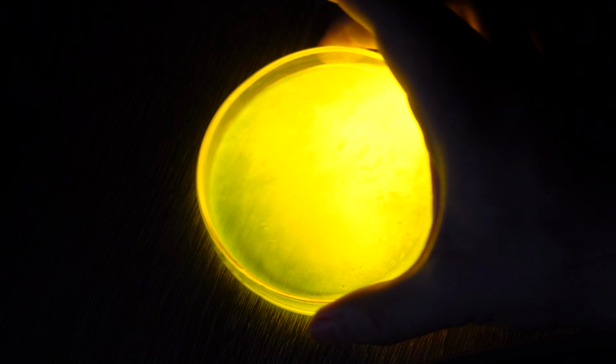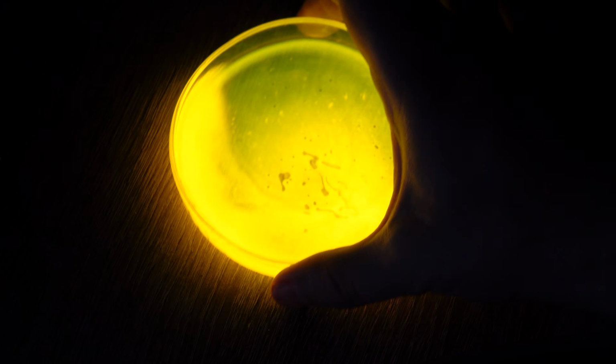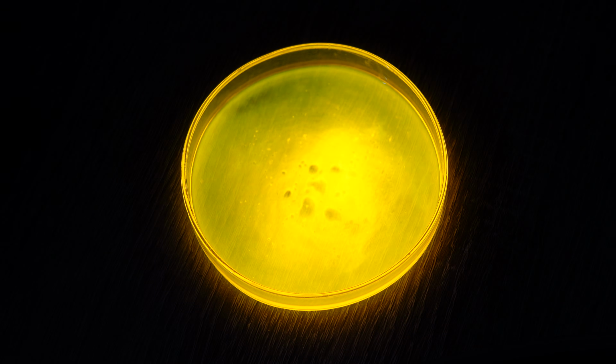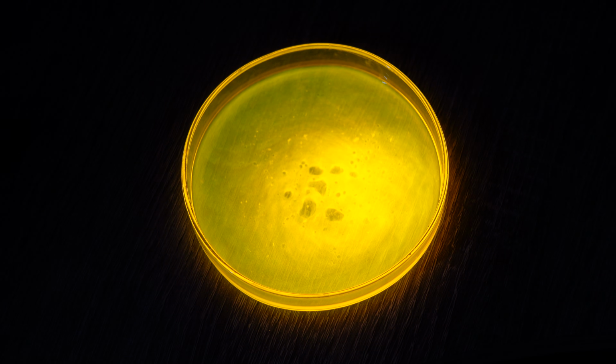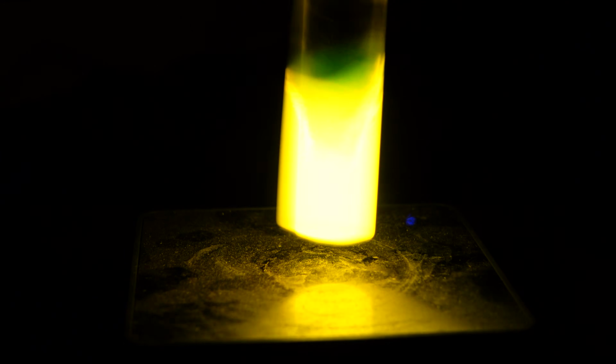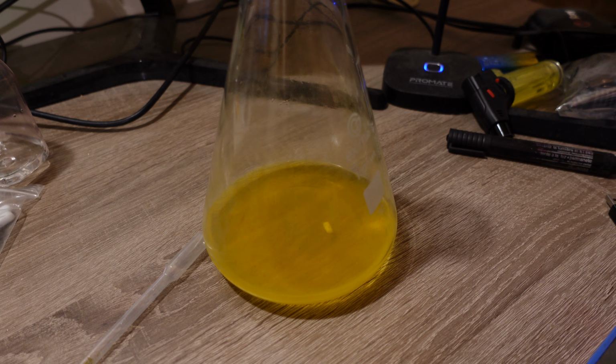I want to remind you that for all the reactions in this video, I used about 100 milligrams of dinitrophenyl oxalate, so 1 gram will be enough for 10 such demonstrations. Dinitrophenyl oxalate and the dye are perfectly legal substances, and they are not harmful unless, of course, you plan to eat them or cover yourself in them. Don't do that. However, there is one danger here, and that's the dye itself. It's very potent, stains everything it touches, and is very difficult to wash off. Handle the dye carefully and everything will be fine.